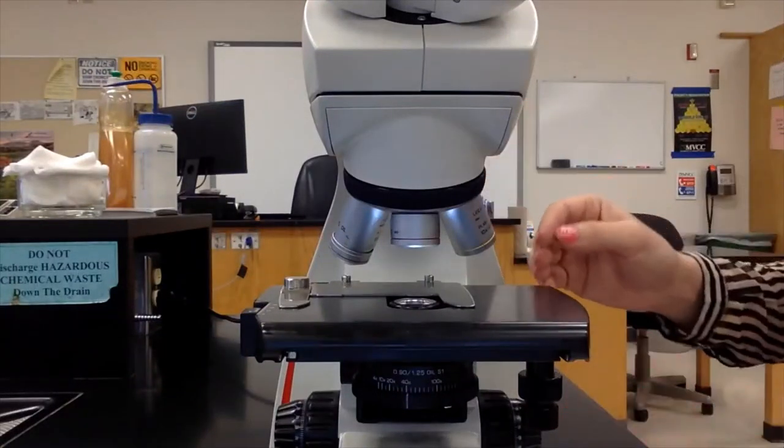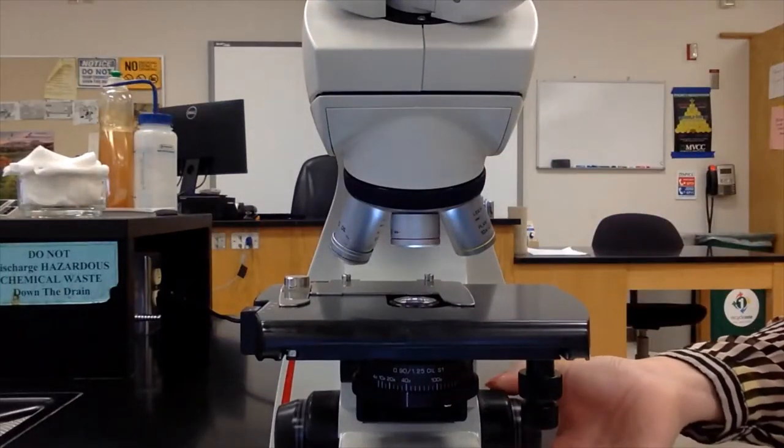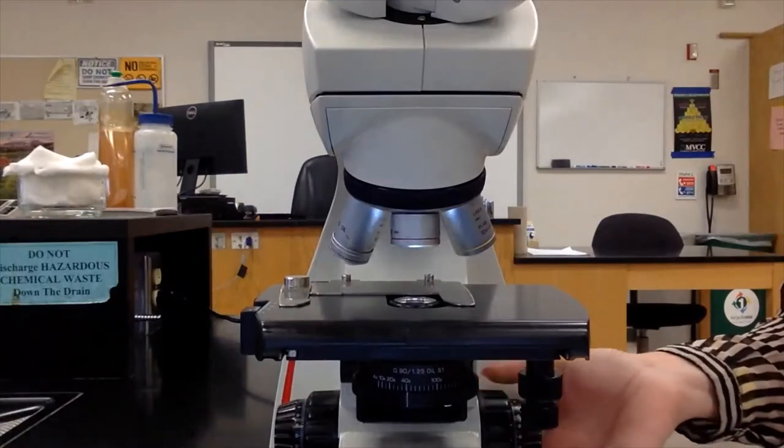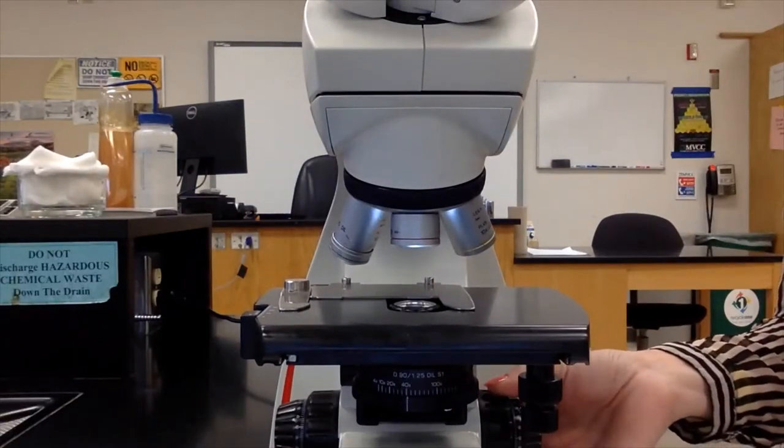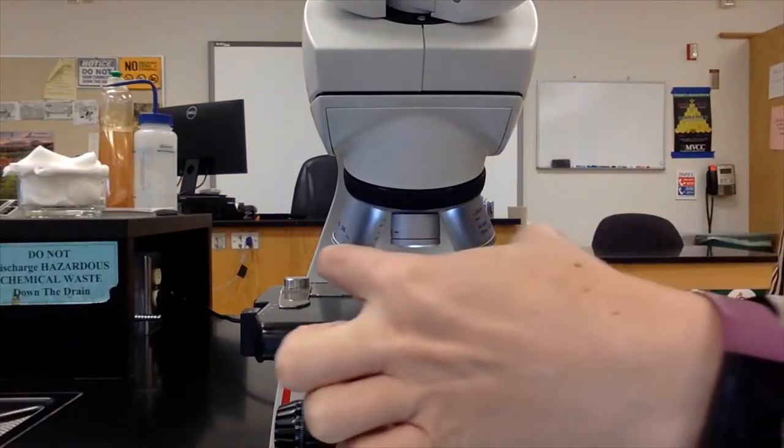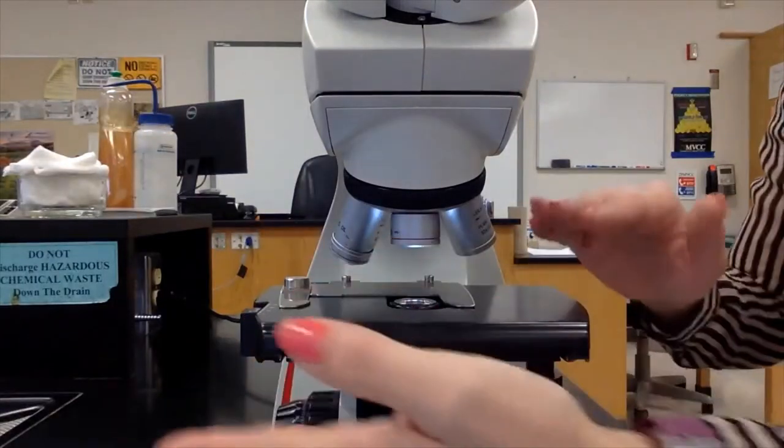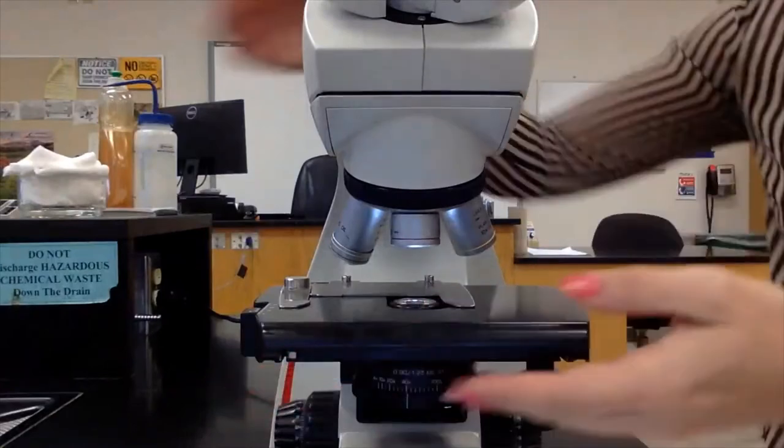We have our stage here which moves up and down using the focus knobs. And if you look at this stage you will see the slide holders which are these metal pieces here.